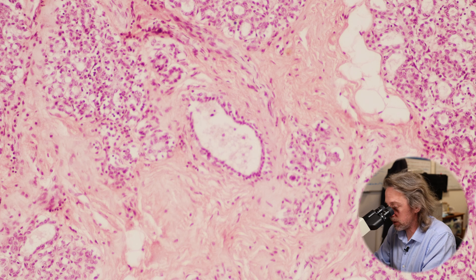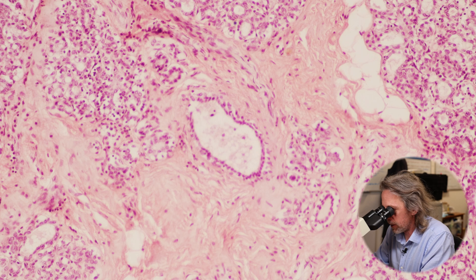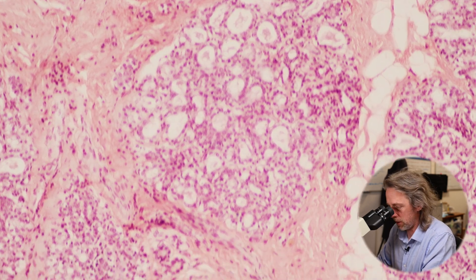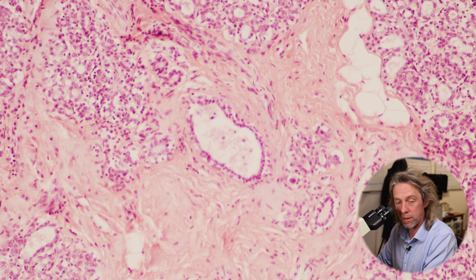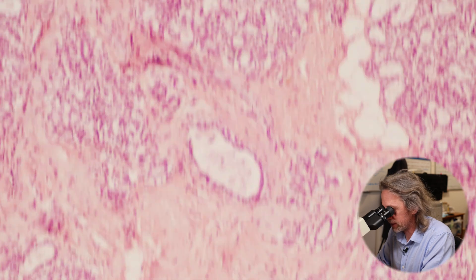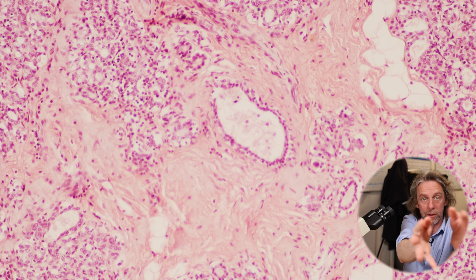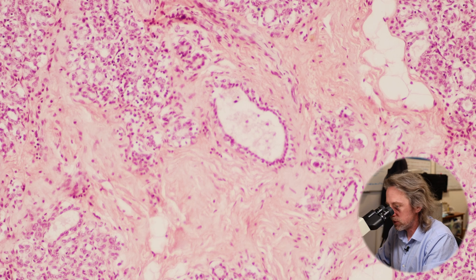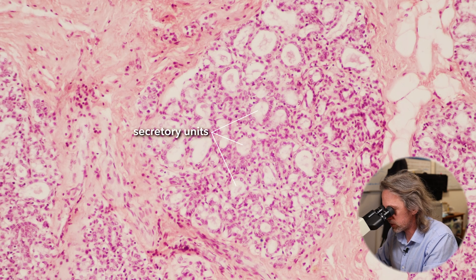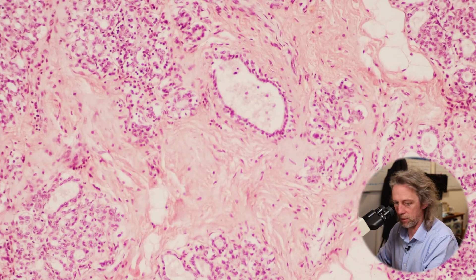We can see that circle in the middle — that's a section through a duct, a tube, surrounded by connective tissue. That is a major duct, whereas that other arrangement is a secretory unit — that compound tubular acini structure. You've got your duct and it branches and branches. Essentially here we've got lots of very small tubules and some acini — small ducts. These are secretory, and those secretions pass out through the big duct.